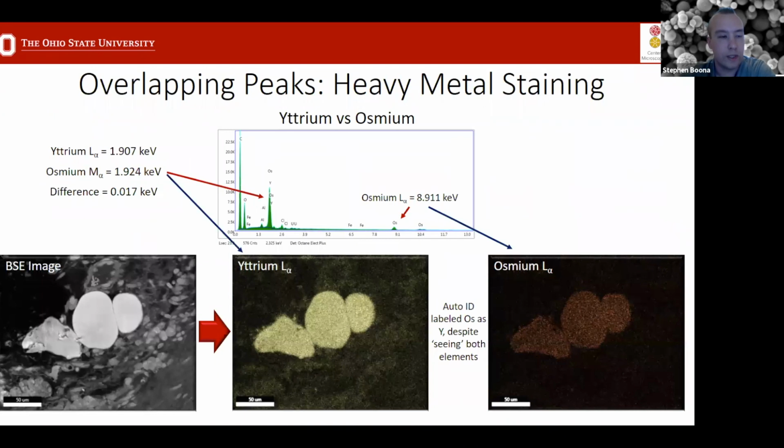So to show you an example of this, here we have a stained tissue sample with heavy metals in it, where the software is looking for the osmium L peak, which is all the way out here, and it sees it and gives you this nice picture. Unfortunately, though, there's also an overlap between the osmium M and the yttrium L at about 1.9. They're only separated by about 17 electron volts. So that's pretty much impossible for most EDS detectors to differentiate.